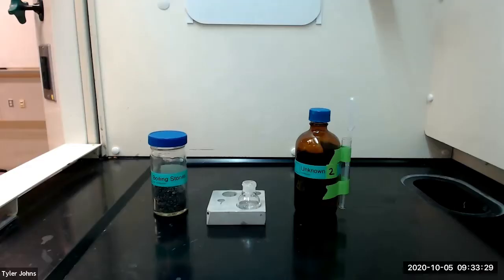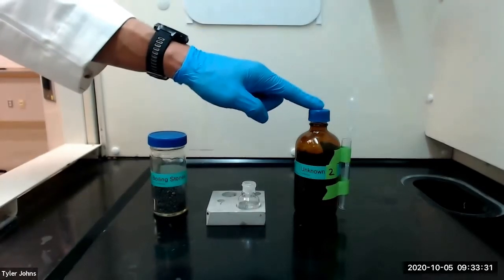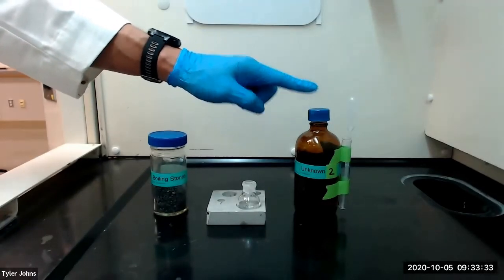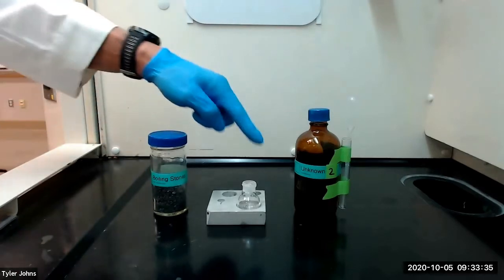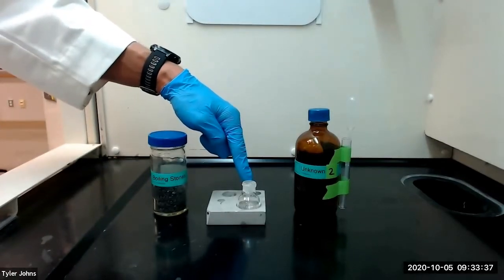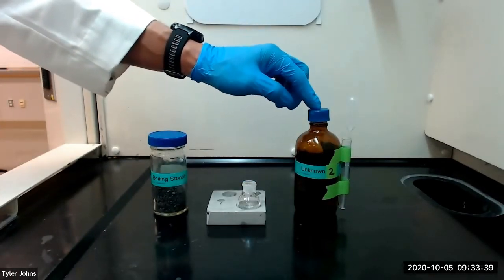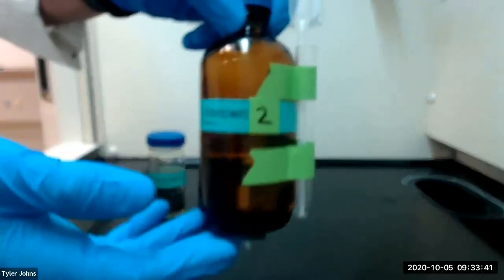We first need to add eight milliliters of our unknown mixture of liquids and a boiling stone to a 10 milliliter round bottom flask. For this experiment we'll be using unknown number two.